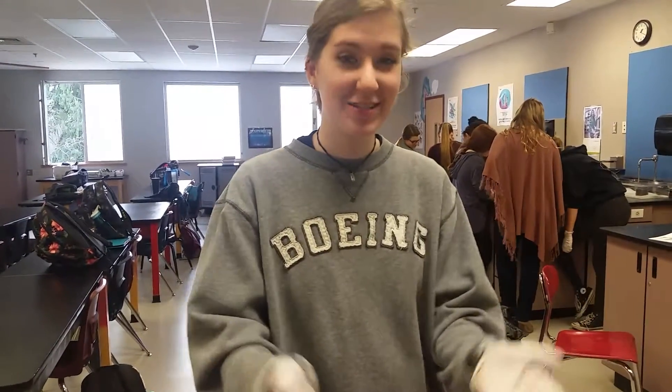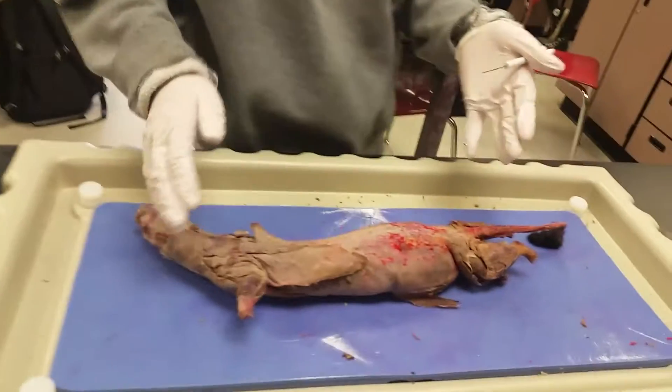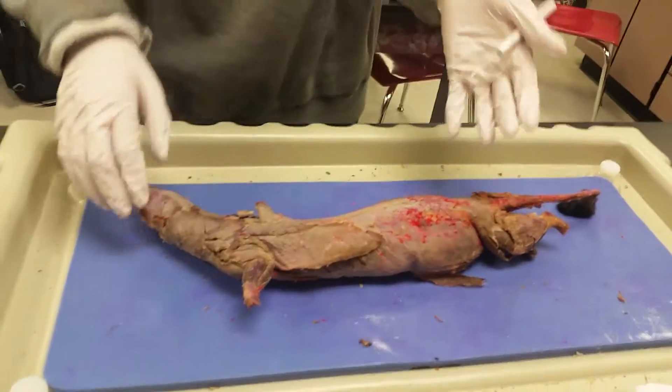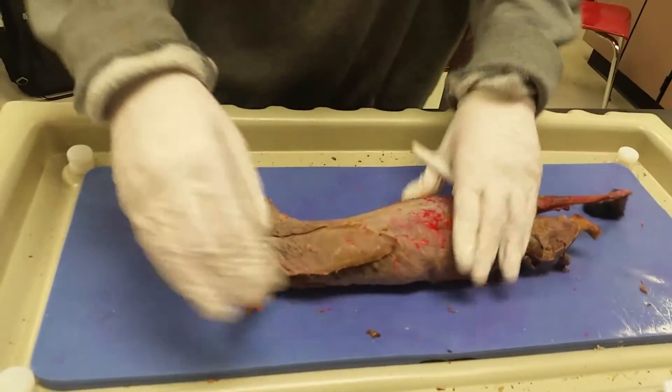Welcome back to Anatomy 101. I'm Dr. Meg, and this is the torso of the mink. First, we're going to be starting with the dorsal part of the torso.